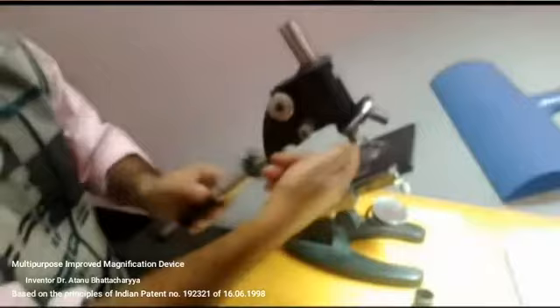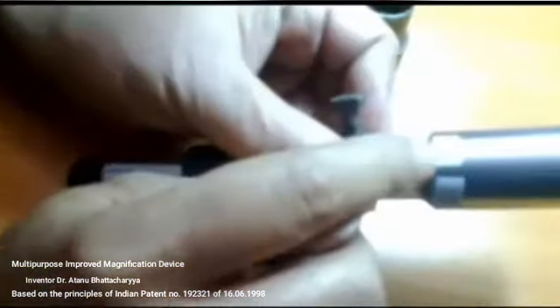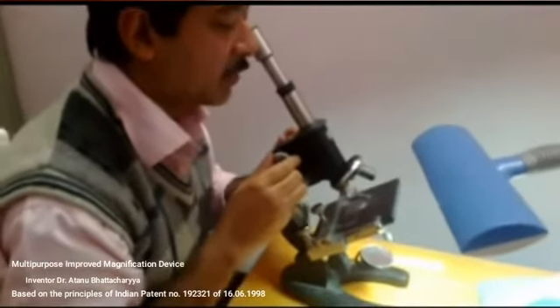Now suppose I use here the 4x objective, the 4x is written here, and I am pulling the tube, and here there is a graduation mark written 7. Then I am putting the graduation mark on the end portion of the T2 tube. So by using the 4x objective of the microscope, if I keep the device here and now I am adjusting it, then 70 times magnification can be achieved.